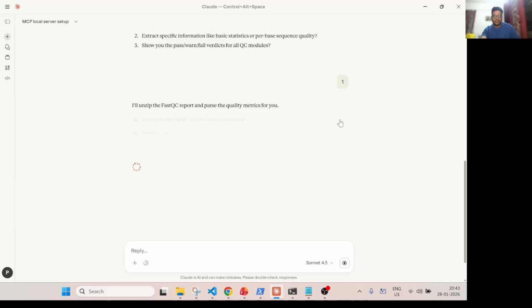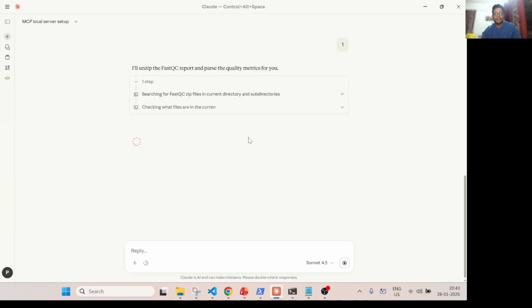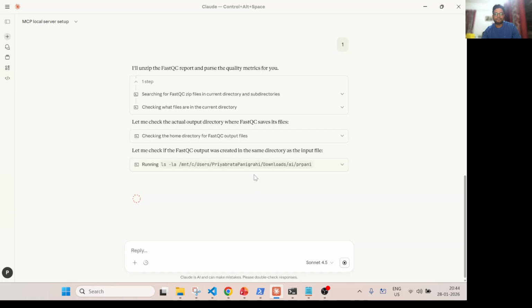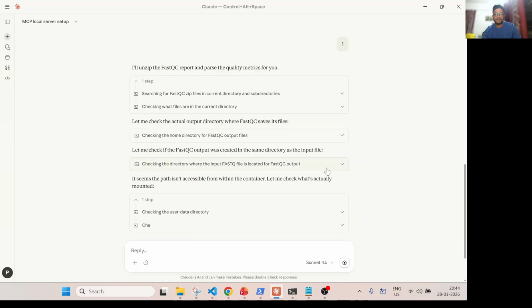Looking for this FastQC output that was created. So now it automatically uses its brain, trying to search where this zip file is. I don't know why it is doing that. Ideally, see, it is very intelligent, and it is trying to search all the files to find where it is. It tried to search this one, but it did not get it, probably.